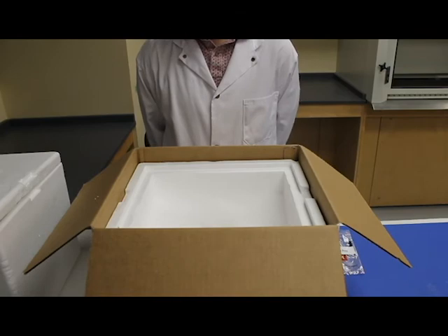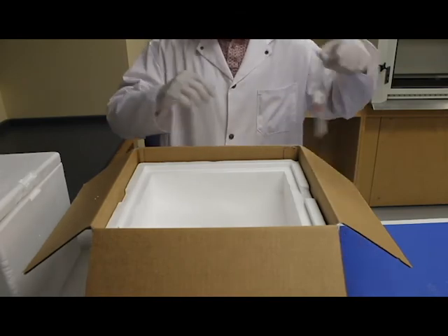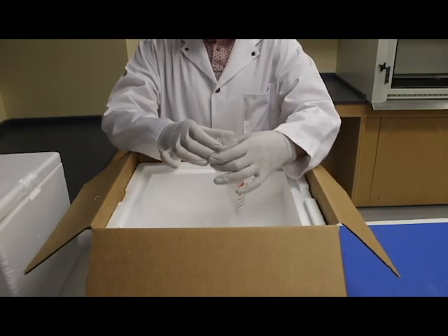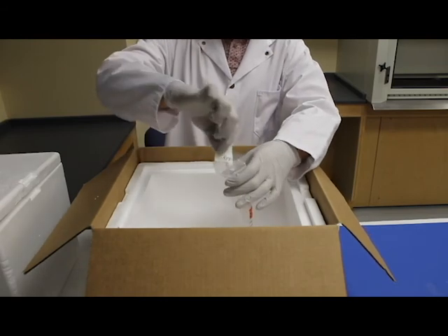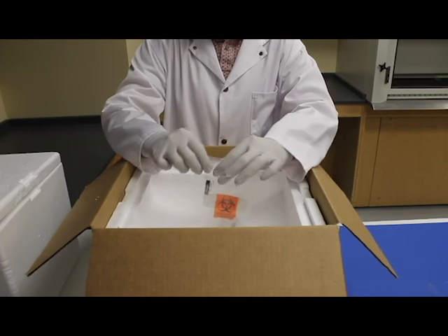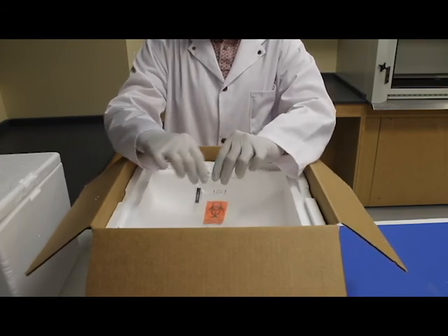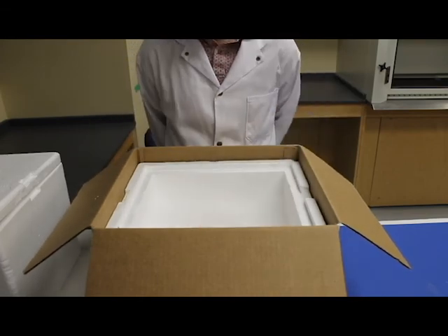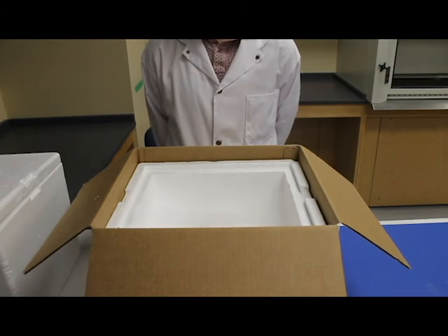When both samples are frozen, place both tubes in the biohazard bag, seal and immediately place back on dry ice. Care must be taken to ensure that the samples are kept cold at all times. Keep exposure to room temperature air and warm fingers to a minimum.